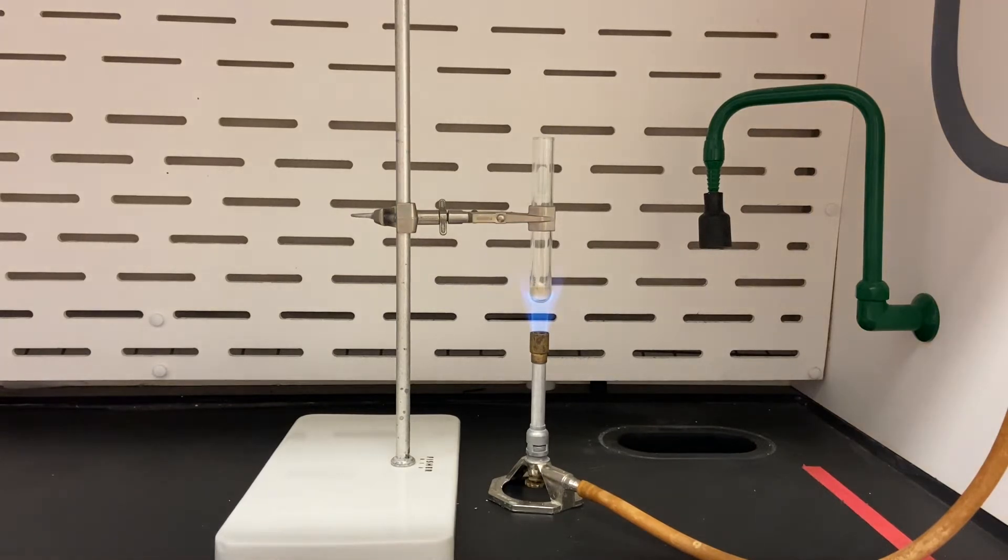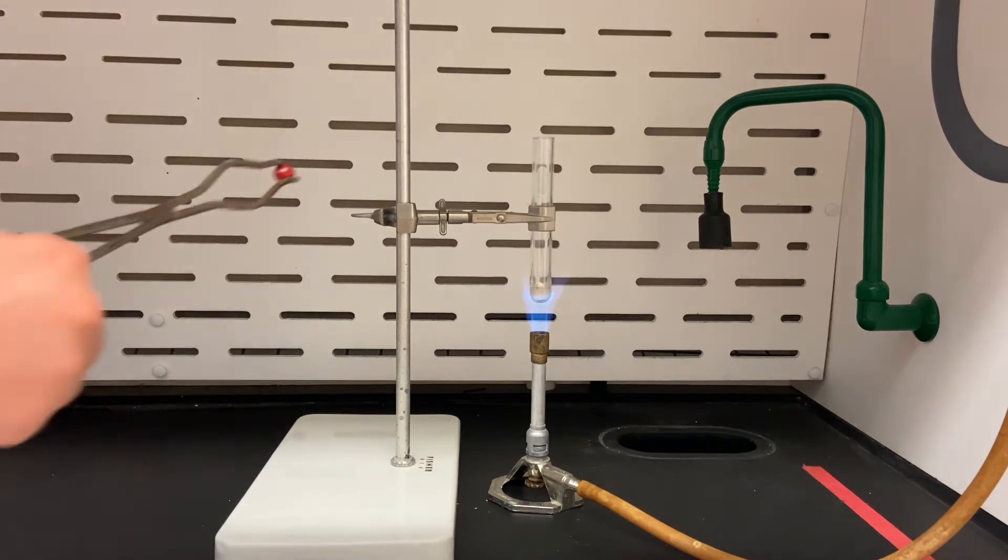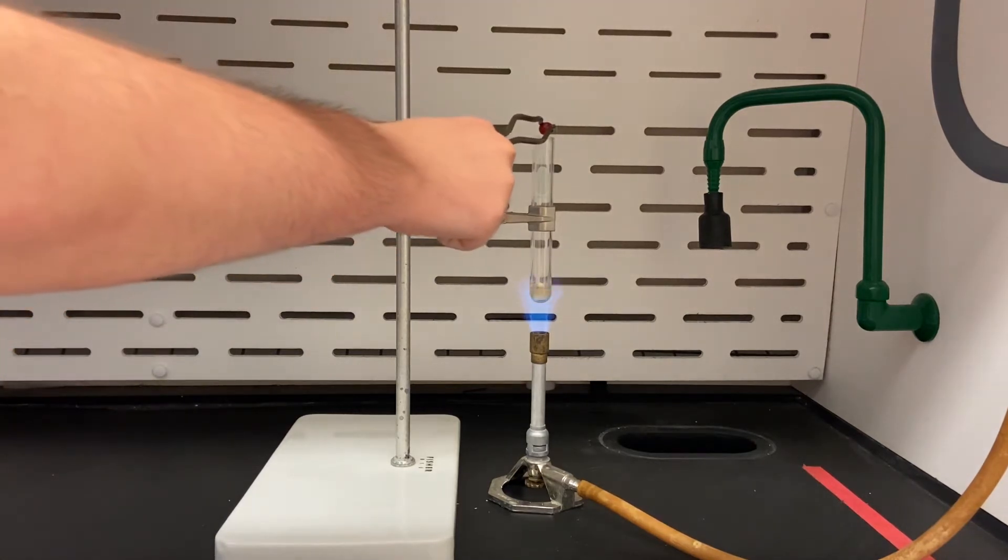Okay, we're going to have Jude reach in here and he's going to drop the skittle in. Go ahead Jude.